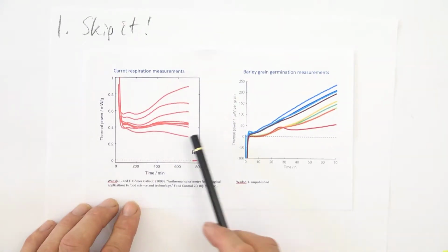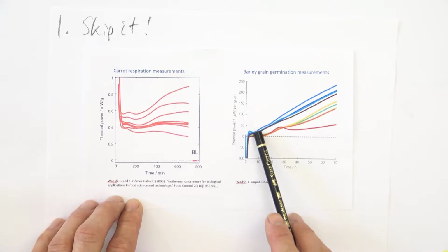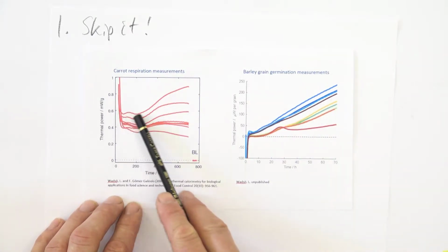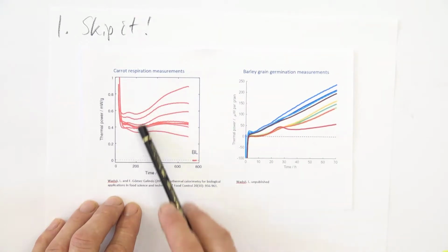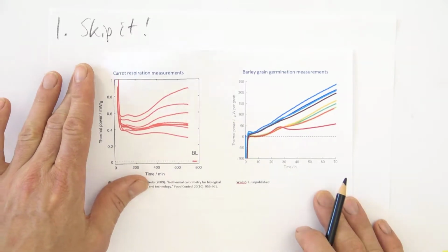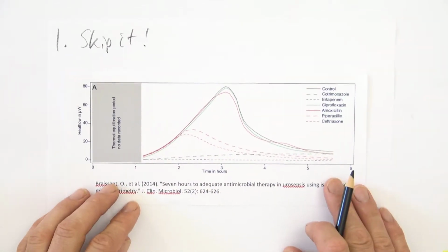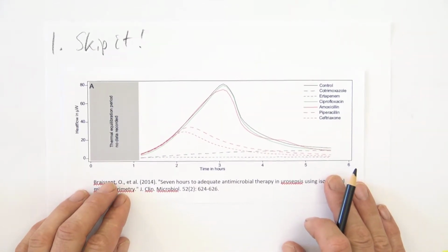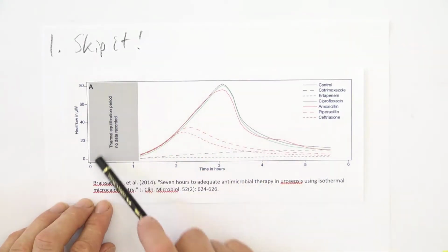In these 2 experiments, we don't need to, because there is no information. The reaction here starts, or the process starts slowly, ramping up. And here we have plenty of signal, more or less constant signal until 250 minutes. So we can skip the initial disturbance, maybe saying that we do so. And here I will show an example of where someone has really told the readers of his paper that there is an initial disturbance and that this should be skipped.